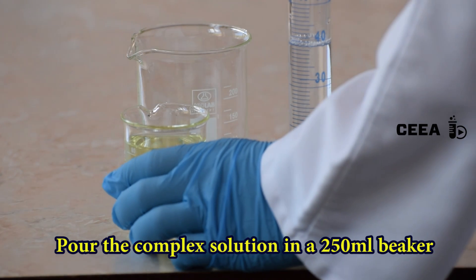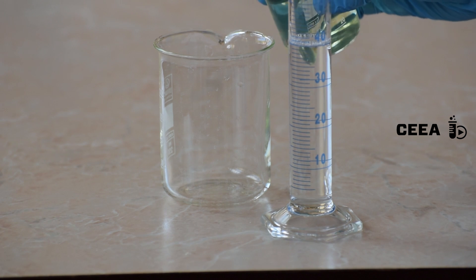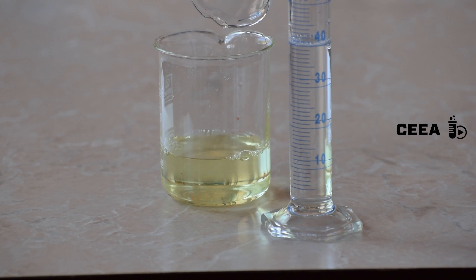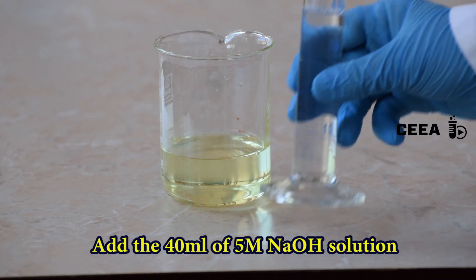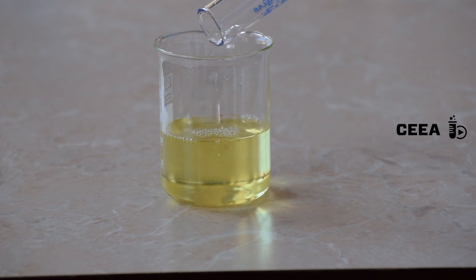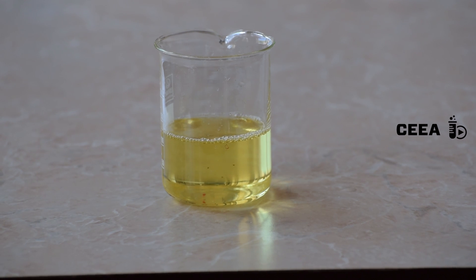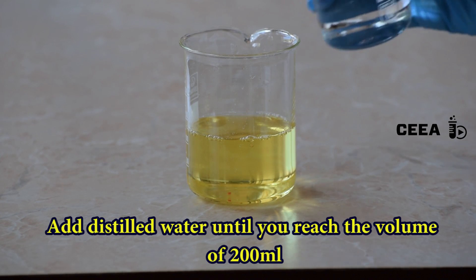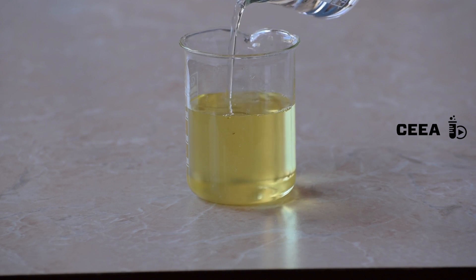Transfer the complex solution into a 250 milliliter beaker and add the alkaline solution to it. The Nessler's reagent is complete when we dilute the mixture to a volume of 200 milliliters by adding distilled water.